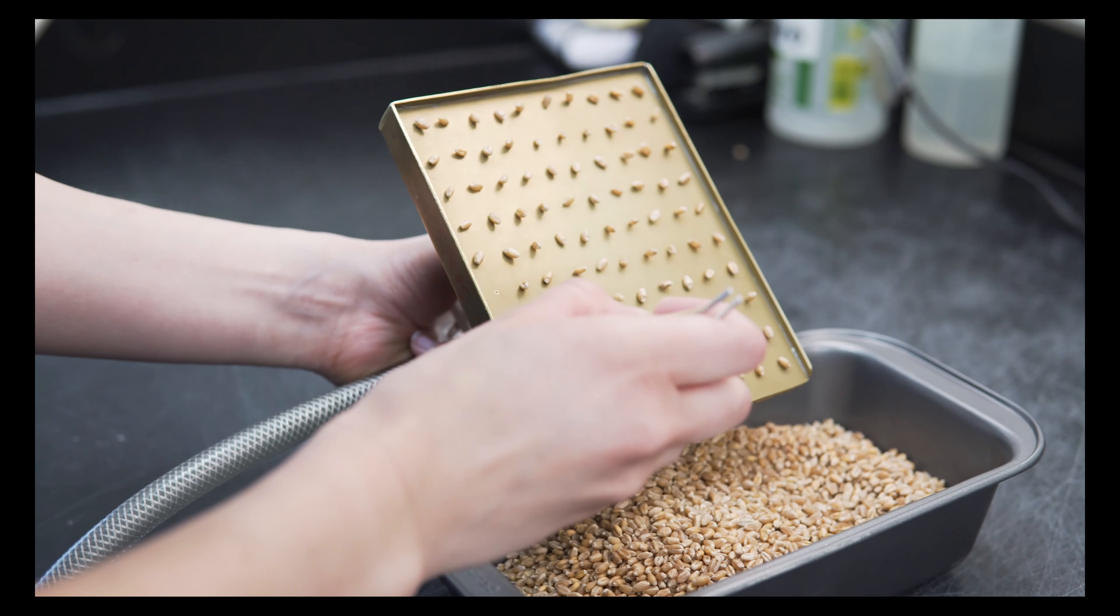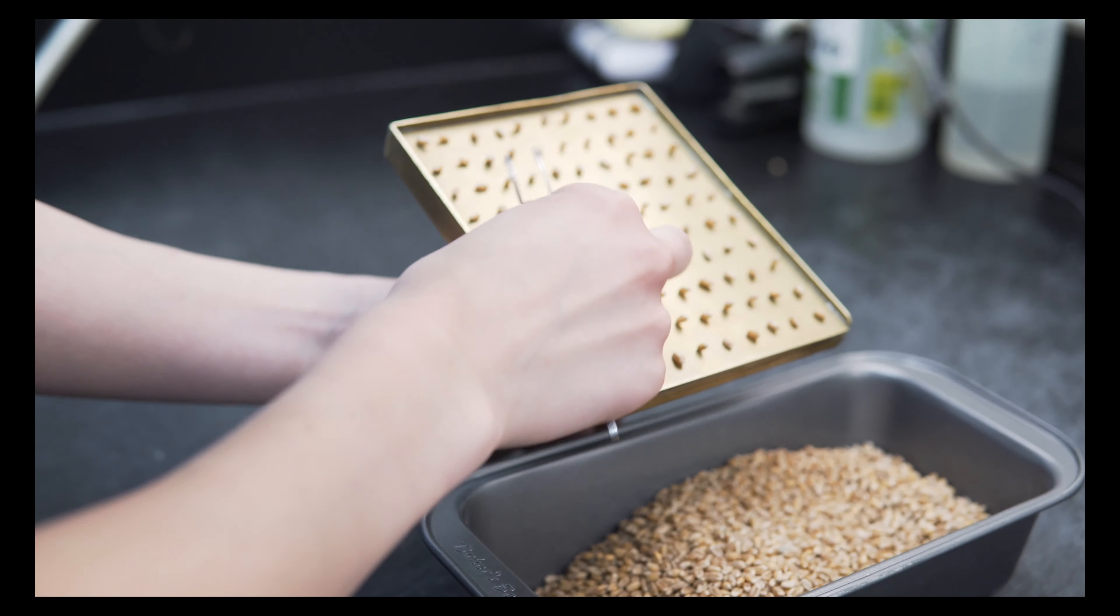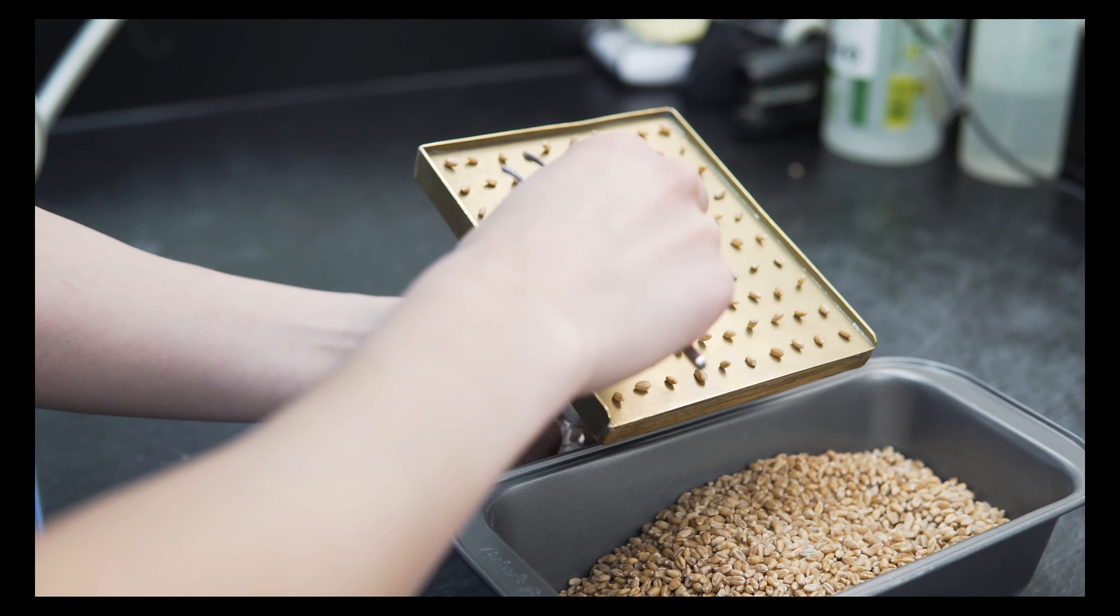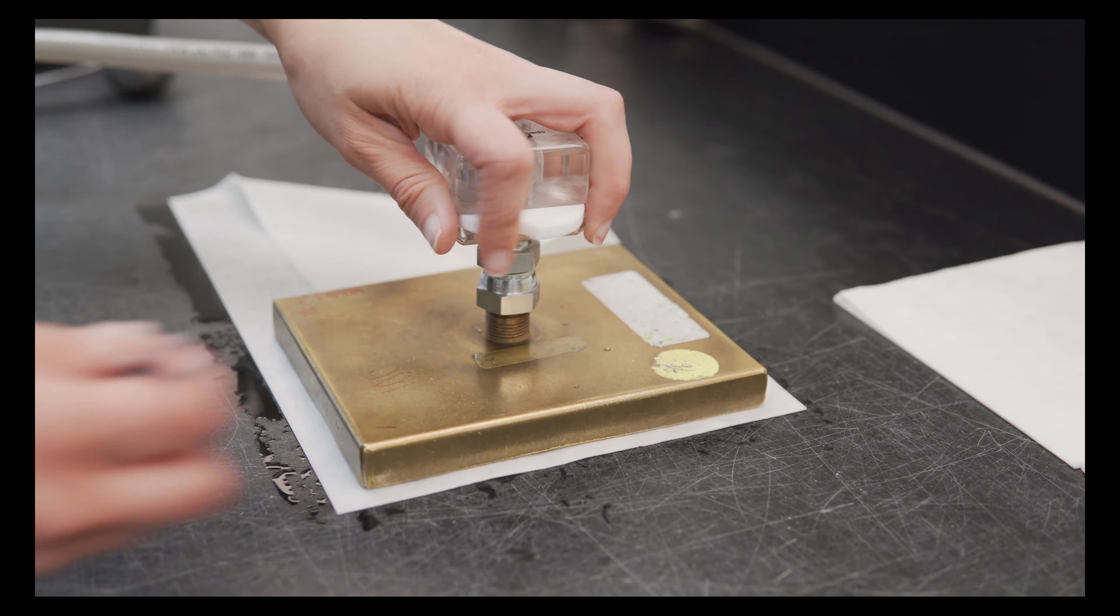Once the vacuum head has all of its holes covered and is evenly spaced, it is planted on paper moistened with water with a pH level between 6 and 7.5.